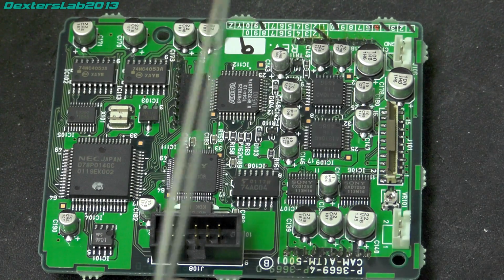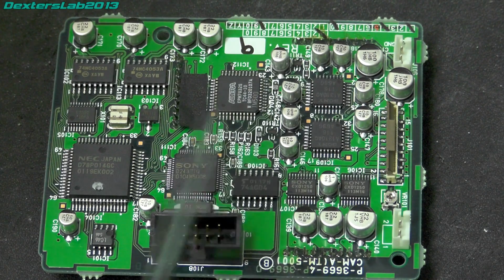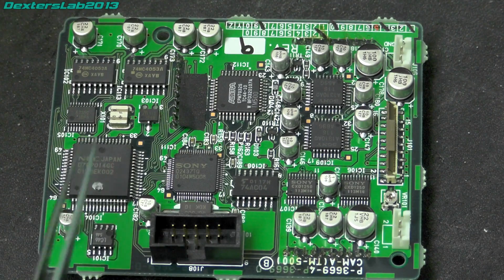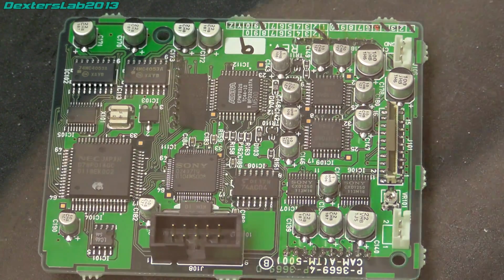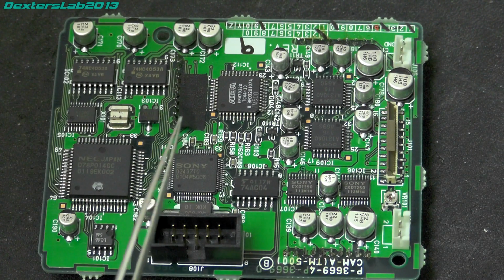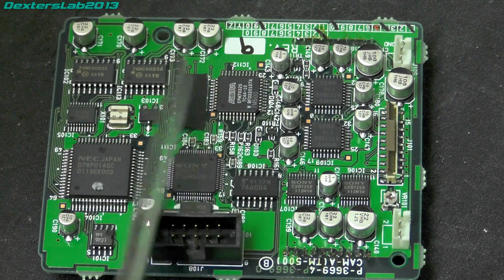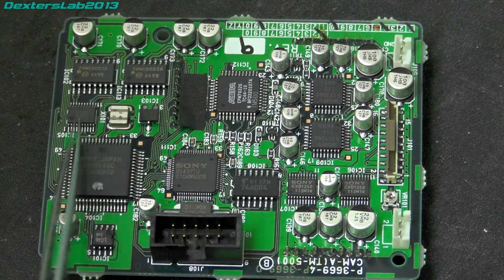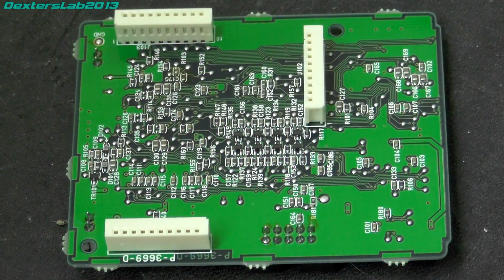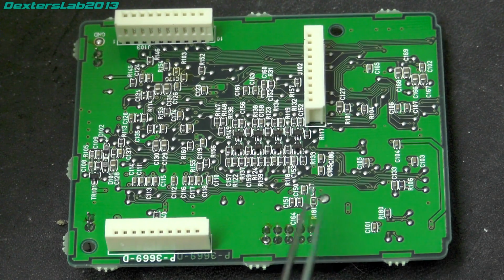there. We've got an Altera EPM 7000 series PLD here, so it's got some programmable logic. We've got an NEC D78P014, which is a microcomputer controller thing that has 32k of internal PROM and 1k of RAM, and some other little 74 series stuff here. So it's possible that these bits here are literally just for controlling that piezoelectric element for moving the CCD around. And all that's on the bottom are some passives and some small transistors. Nothing really much to speak of.